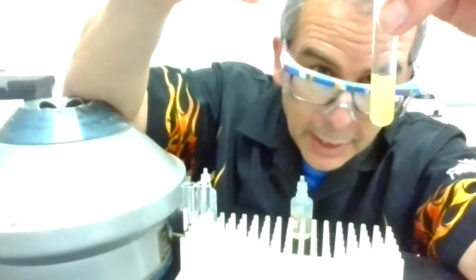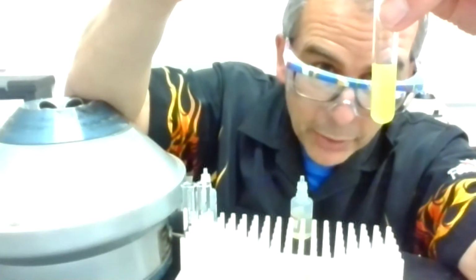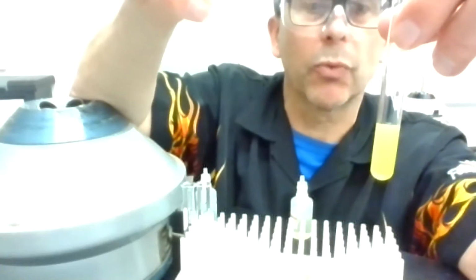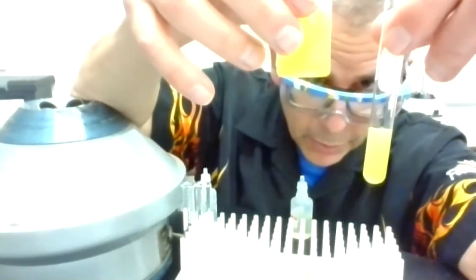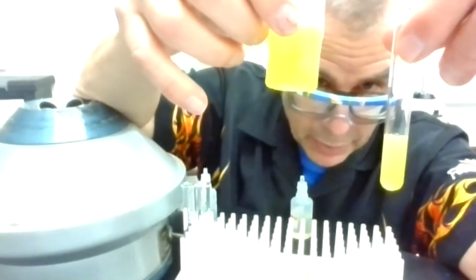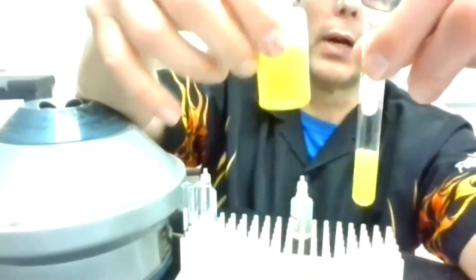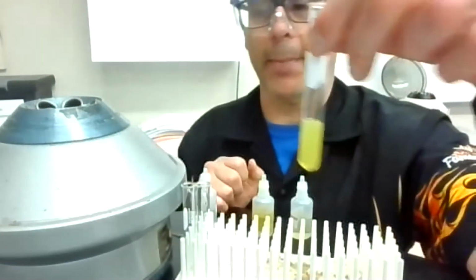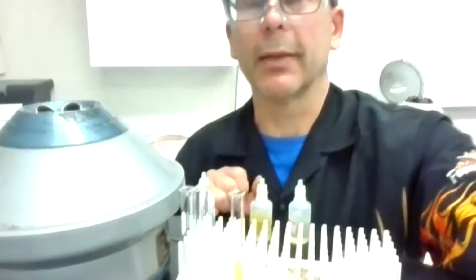So notice it's getting yellow as I add this, but I don't see any distinct cloudiness. And I know with CrO4, if that is a test where something is precipitating, it'll get really cloudy right away. So I'm going to say with this, even though there's some haziness, I didn't see any additional haziness when I added the CrO4 2-. So I'm going to go with that. And that is your information for letter E, unknown E.